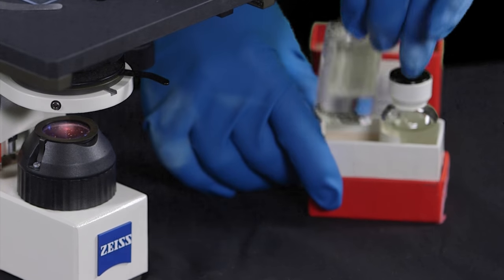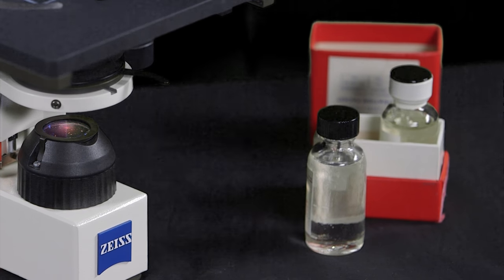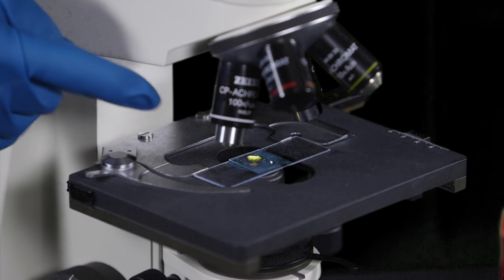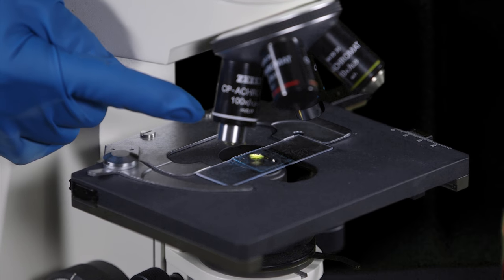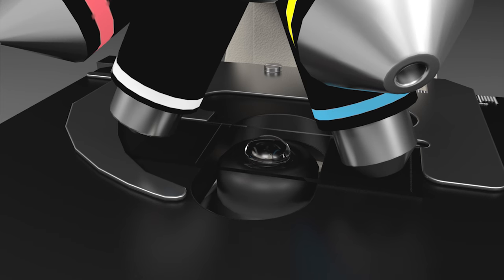Focusing the specimen and re-centered at 40x magnification, the nosepiece should be turned so that the 40x objective and the 100x objective are straddling the specimen. A drop of immersion oil should be placed on top of the slide immediately above the light source.